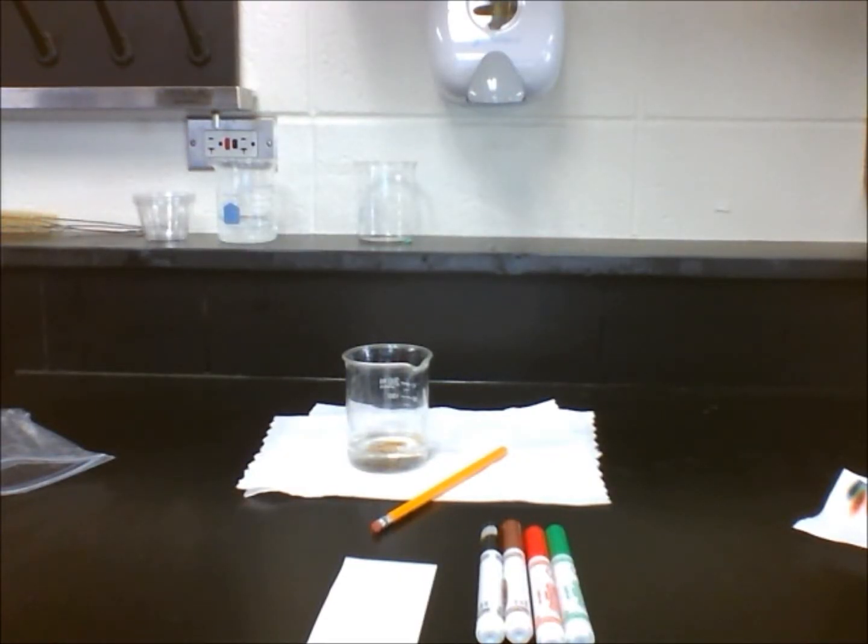In this lab, students will analyze the composition of four different colored markers: black, brown, red, and green.